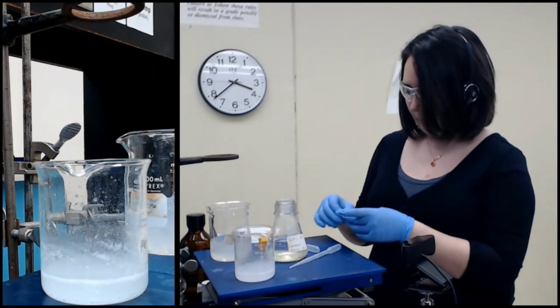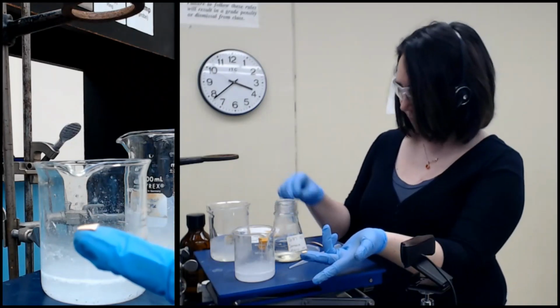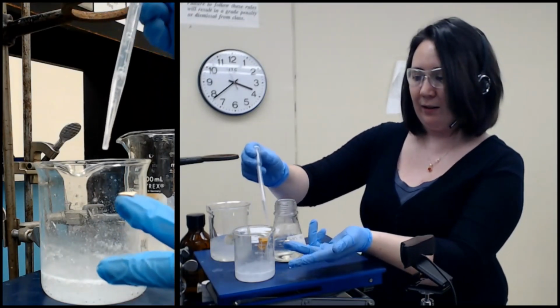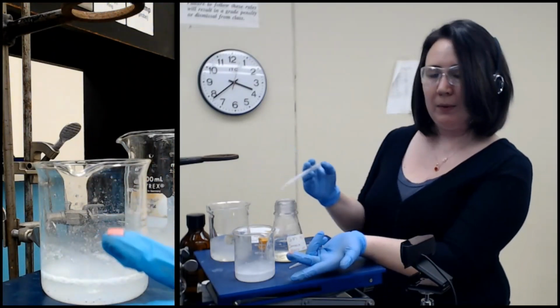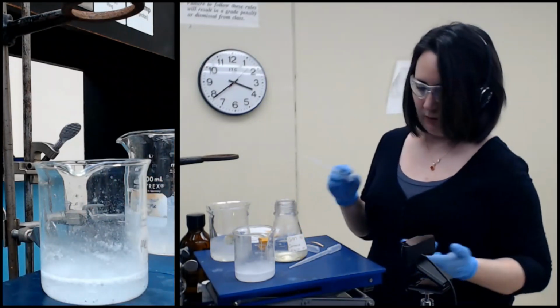Now's a good moment. I'll go ahead and check the pH. Check a different finger. New pipette. I don't want to use the one that I've been using to grab acid, and I don't want to use the one that I started with, so I just grabbed a new pipette. One drop. That's a nice pink color. Maybe about a 3. I think I'm accustomed to a slightly stronger pink.